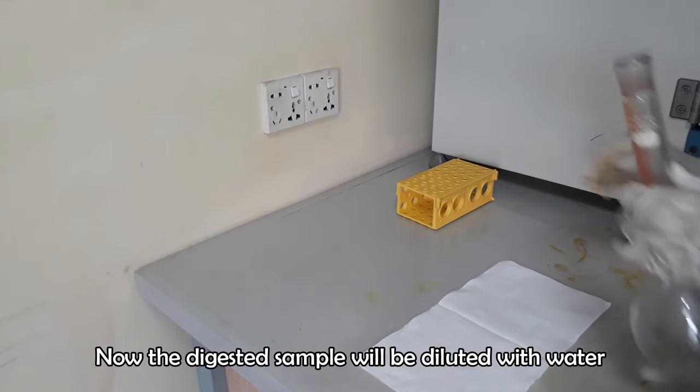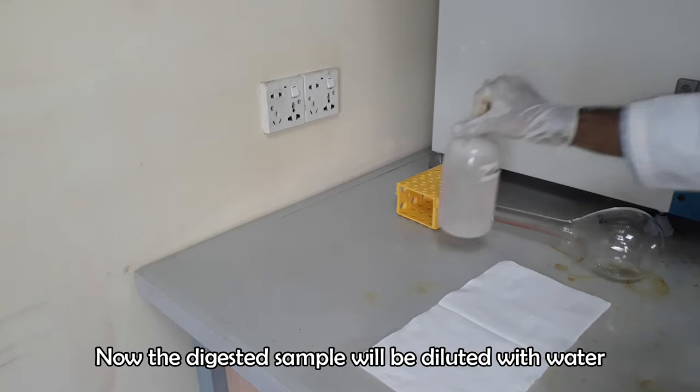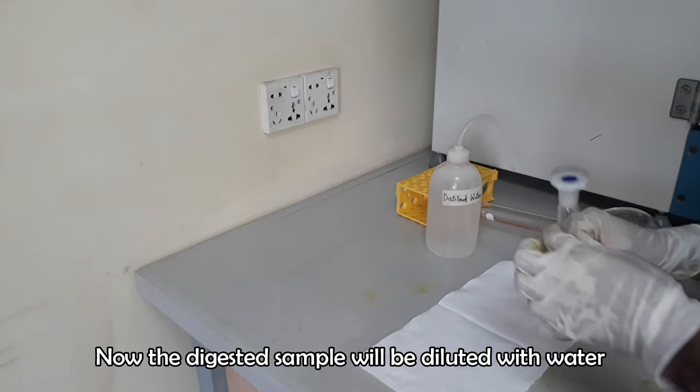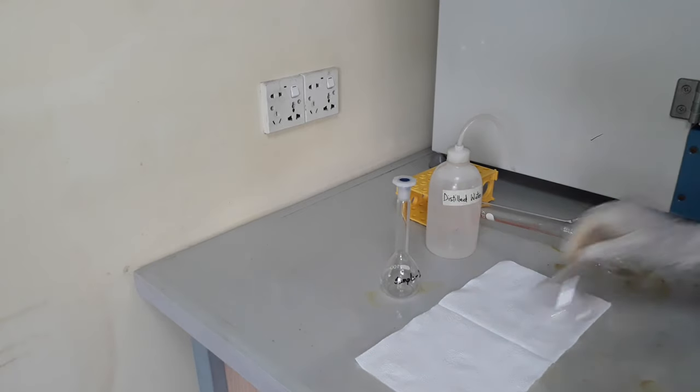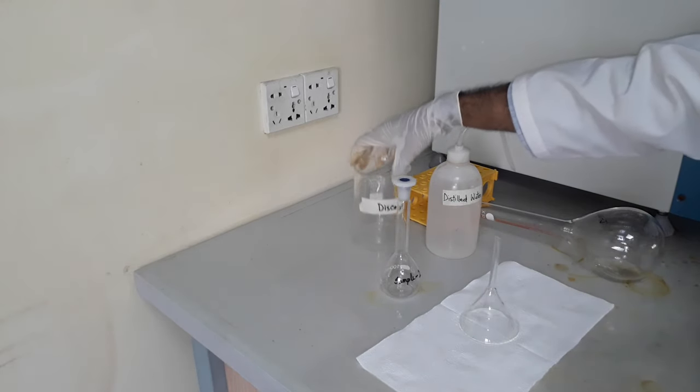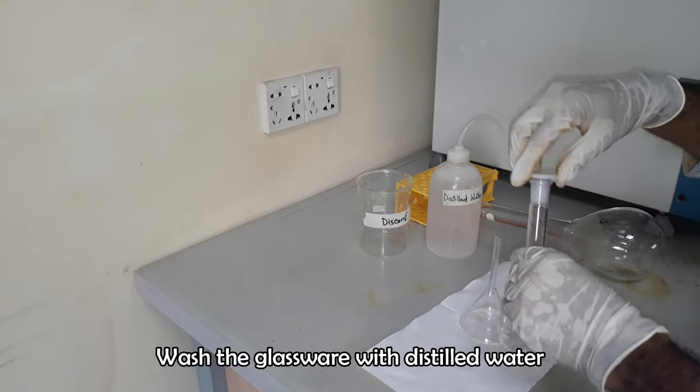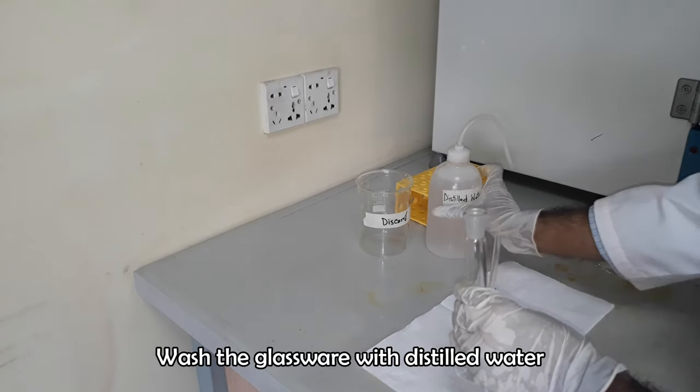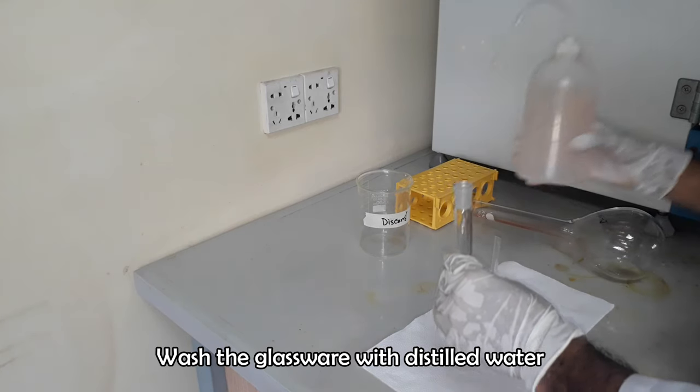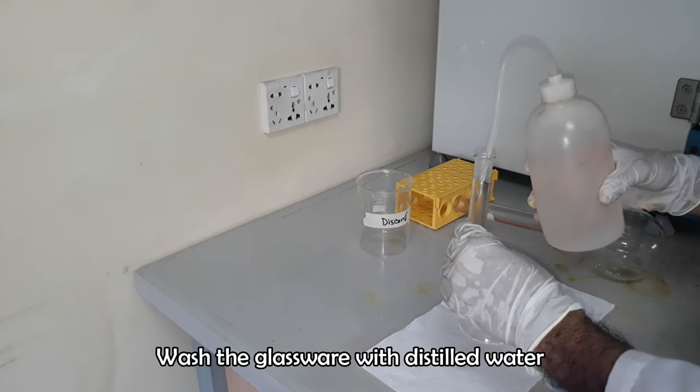Before going to the distillation, we have to dilute the digested juice with distilled water. Gather everything you need to do this dilution. Wash the glassware with distilled water.